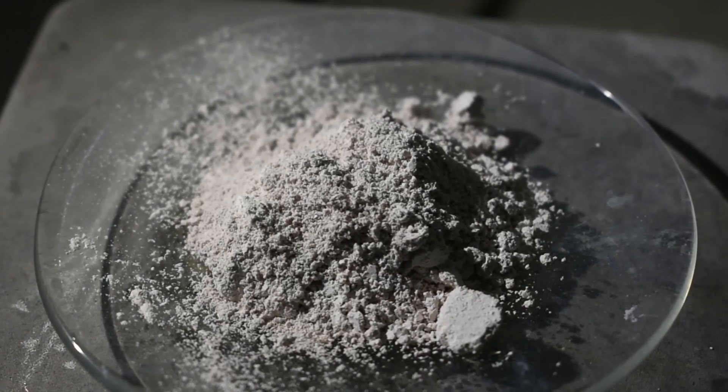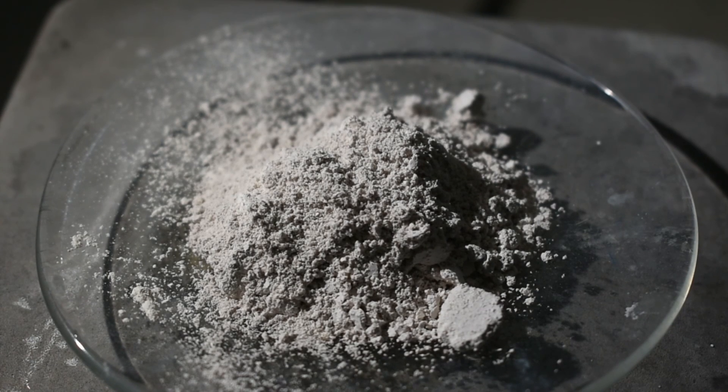And there we have it. Some nice, dry, slightly off-white barium peroxide.